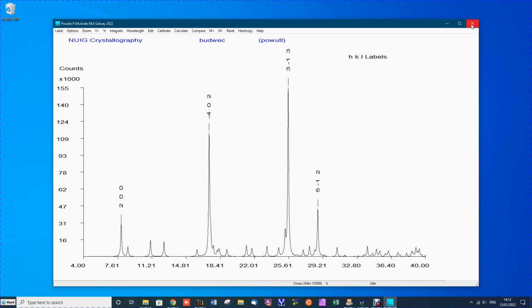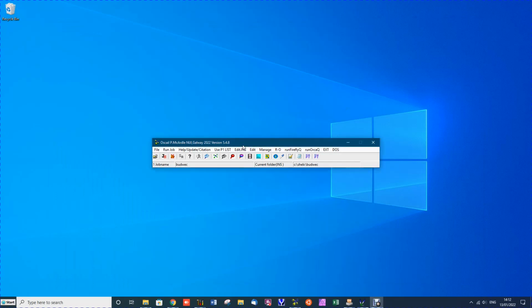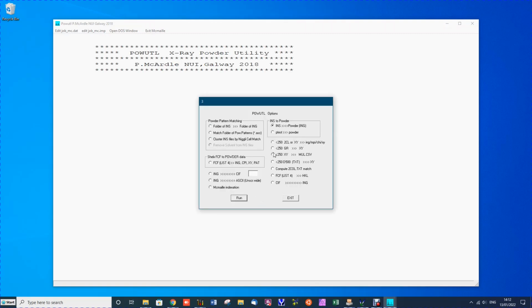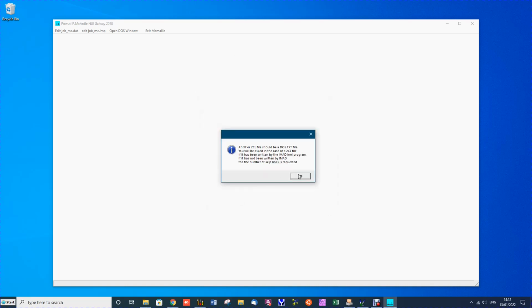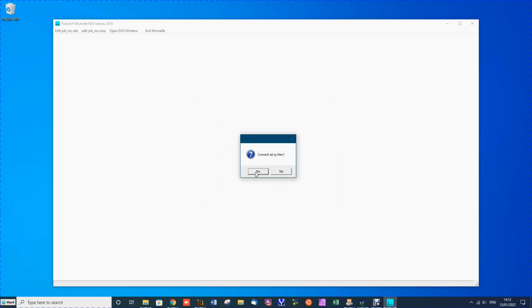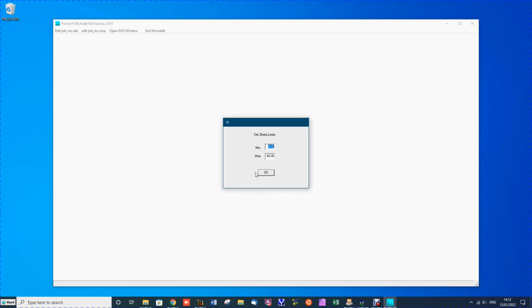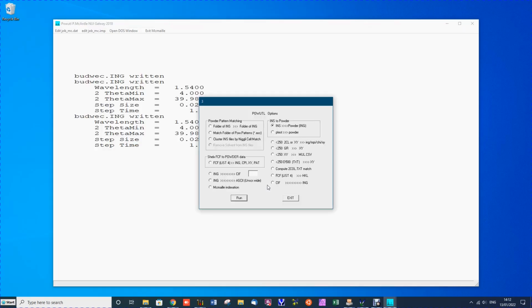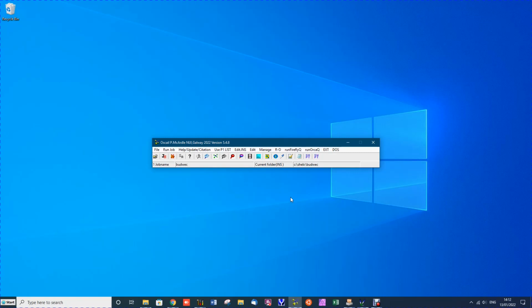Now we can easily convert those XY files that we have to files that Oscail can read using the powder display function. So we run the powder utilities function first, and there we see we can convert up to 250 XY files to the ING format that Oscail uses. This is very easy to do. You can default on all the options. And then the program runs very quickly and the files are written.